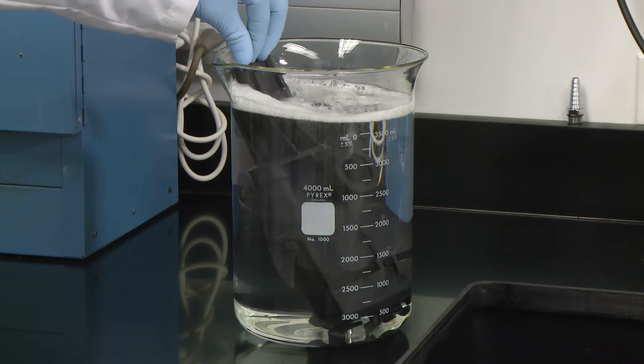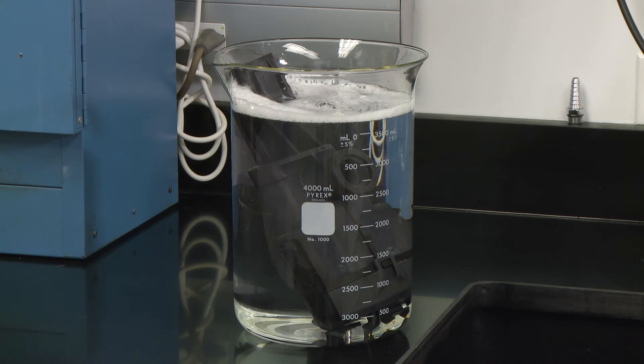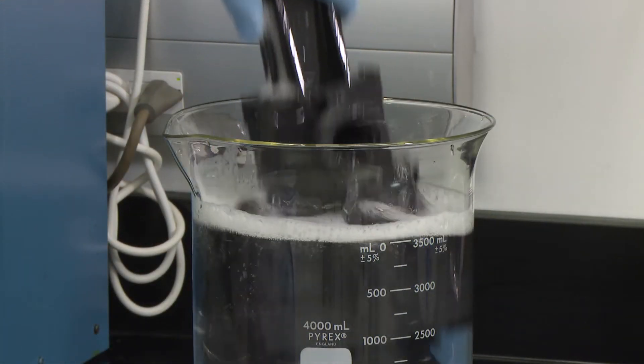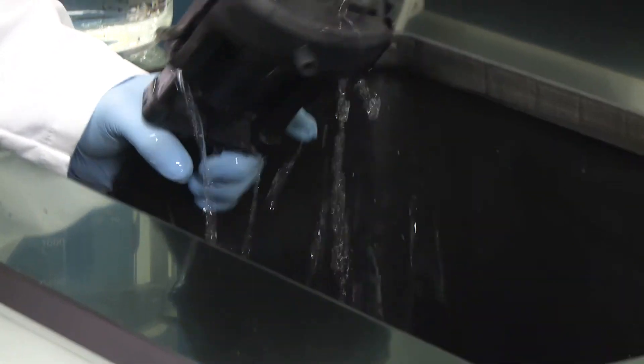Depending on the sample type and how often cleaning is performed, cleaning of the burner assembly may change. Remove from the detergent solution and then flush well with deionized water.